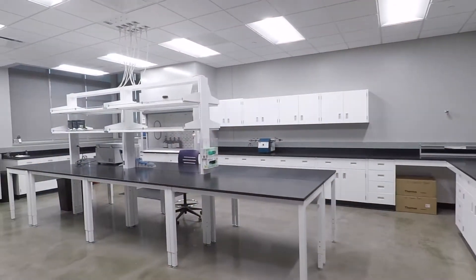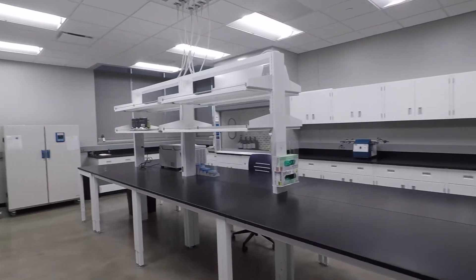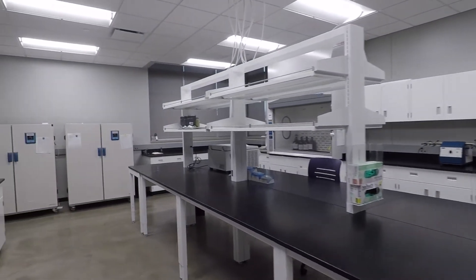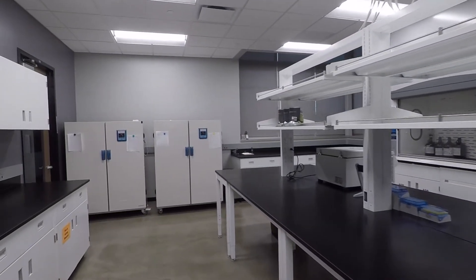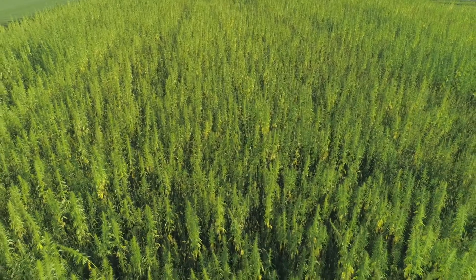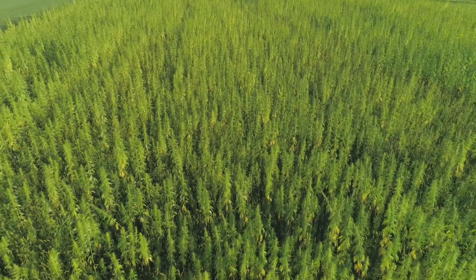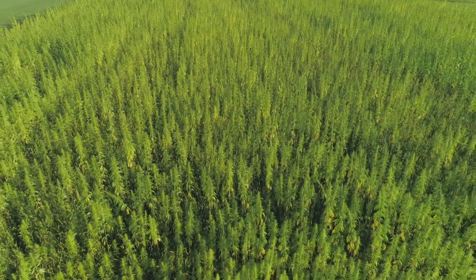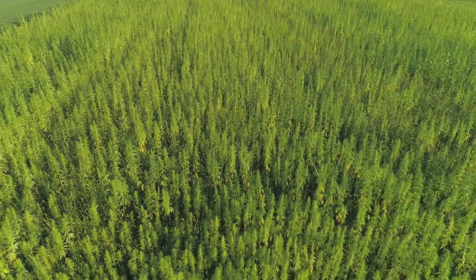The KDA Industrial Hemp Laboratory analyzes hemp samples to ensure compliance with the legal definition of industrial hemp. The lab is busiest in the fall but receives samples throughout the year.